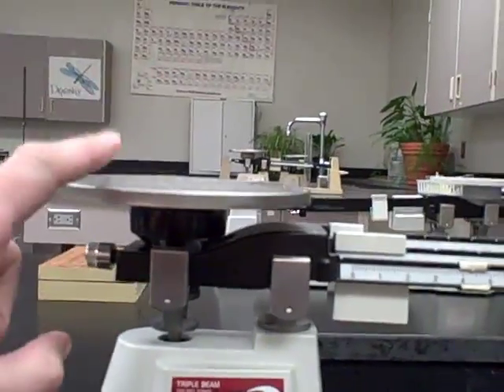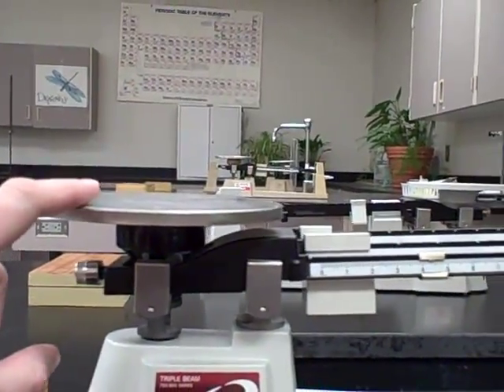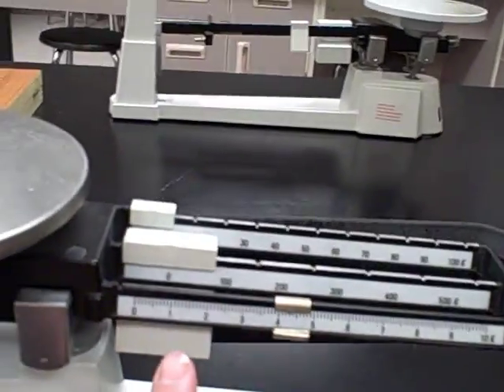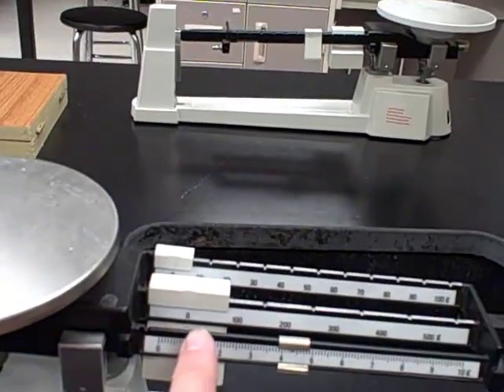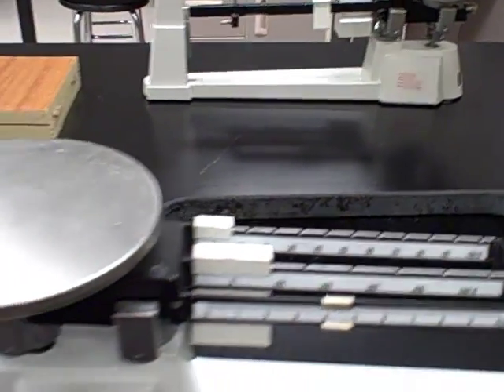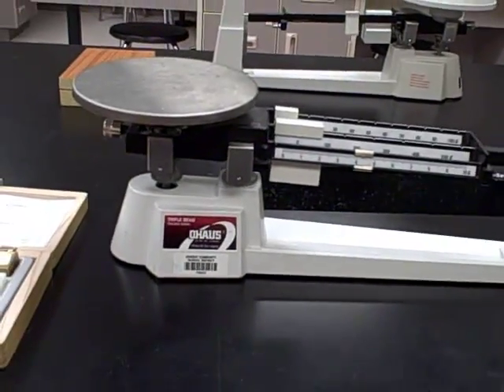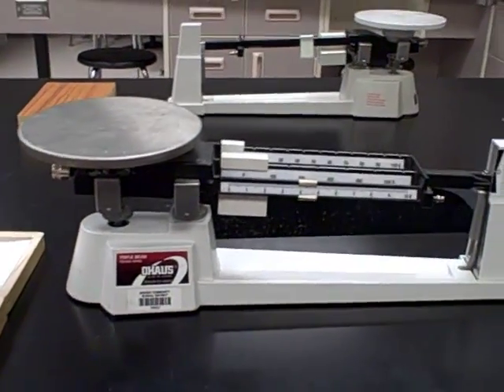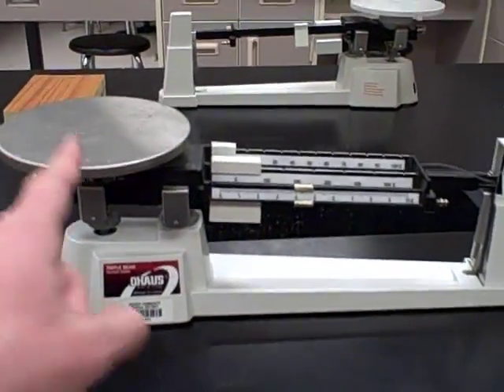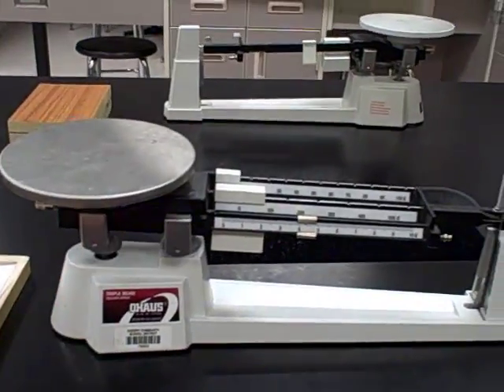You're going to place your mass on top of this pan, and you can see there's three beams with what we call riders. You're going to slide those across to the right and balance out whatever you put over here.